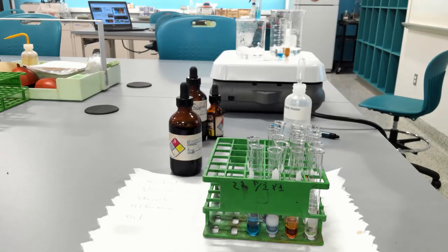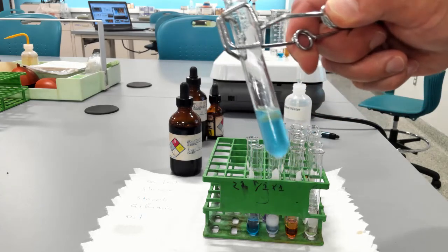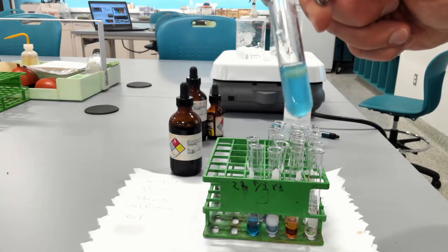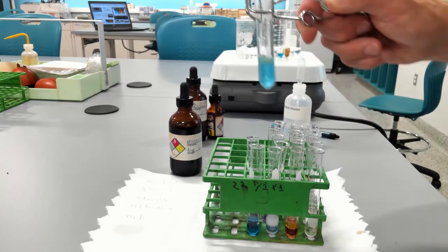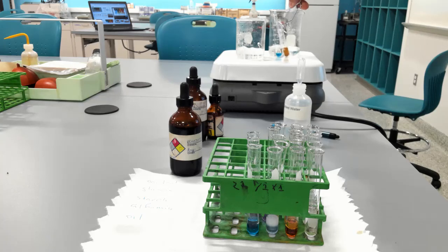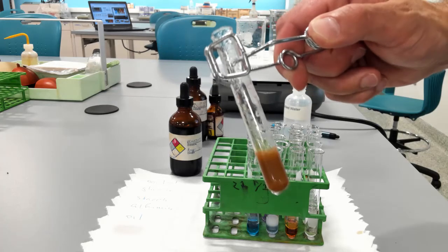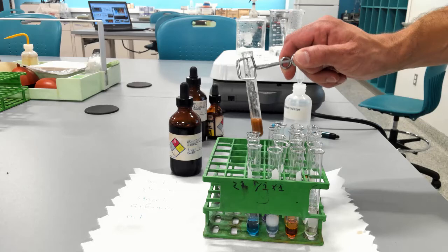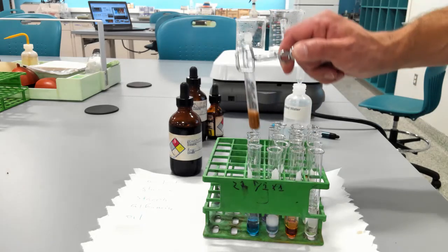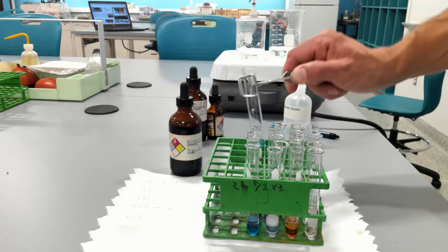So this is the starch, and it's interesting, you can see a little bit of yellow on top. It's probably due to some presence of simple carbohydrates in the starch. And here you have a solution of dextrose, so simple sugar, basically glucose. Okay, it turns yellow. And the control, here nothing happens to it.